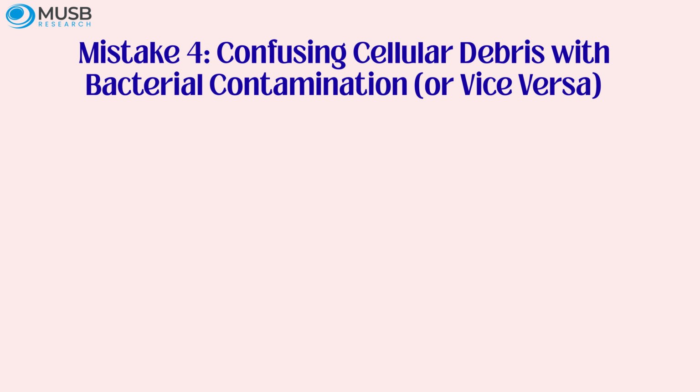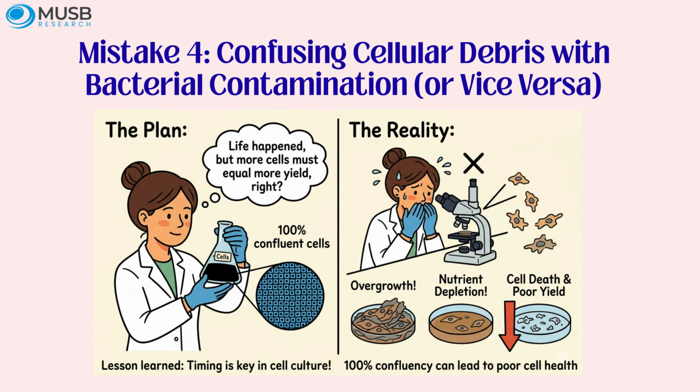Mistake 4. Confusing cellular debris with bacterial contamination, or vice versa. You look at your cells and see small, dark particles floating around. Your heart rate spikes. Contamination. You throw the flask, disinfect the hood, and file an incident report. Except those were just dead cell fragments, apoptotic bodies shed during normal culture turnover.